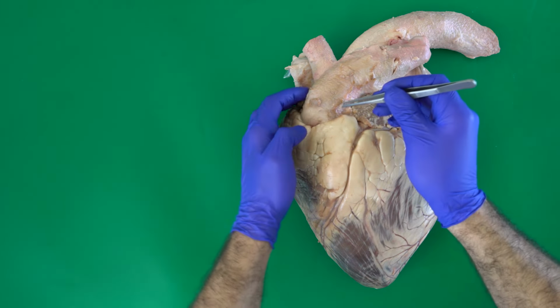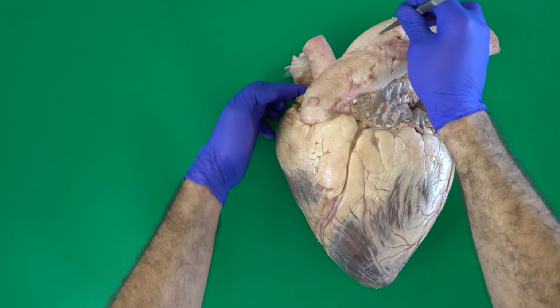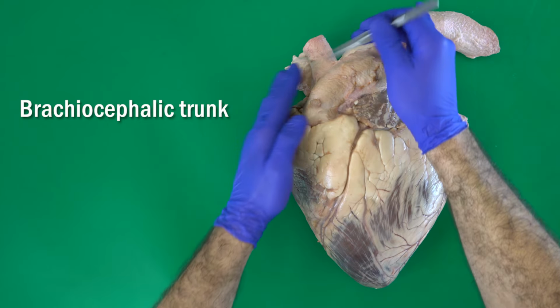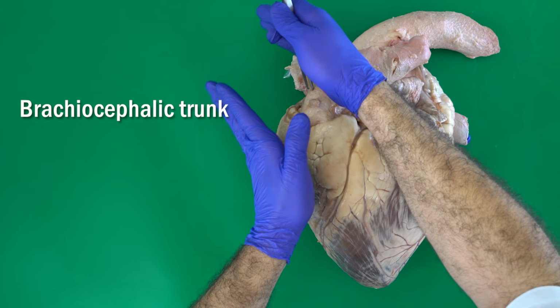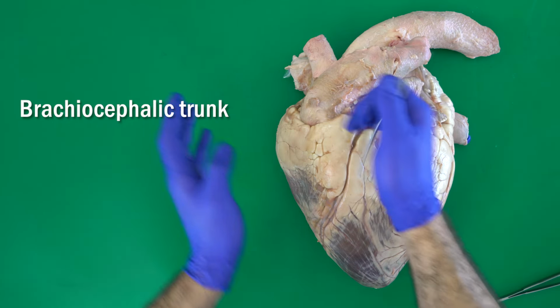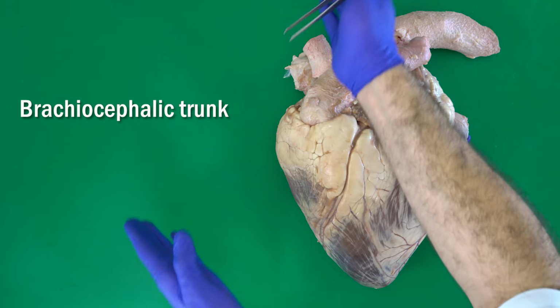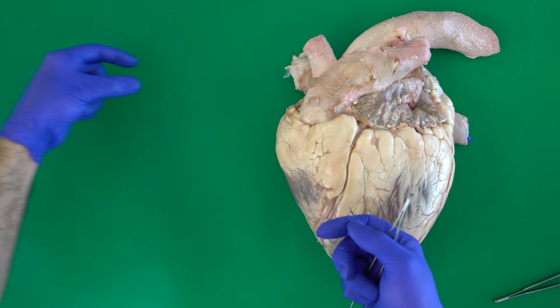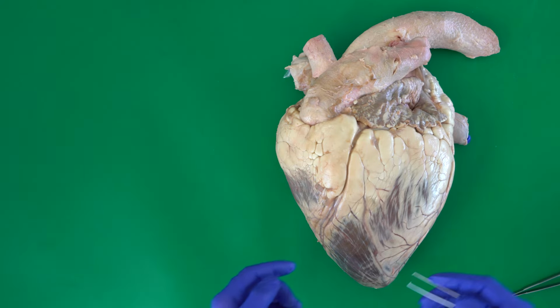As I said before, the coronary arteries are the first two branches from the aorta to the heart itself. After that we have the brachiocephalic trunk, which moves cranially and gives, inside the thoracic cavity, the two subclavian arteries, and after that the two common carotid arteries. The subclavian arteries give some branches in this area and finally move to the forelimbs. The common carotid arteries move to the neck, and finally to the head.